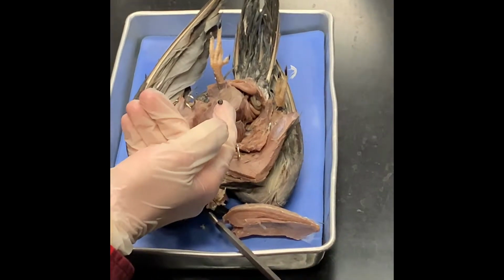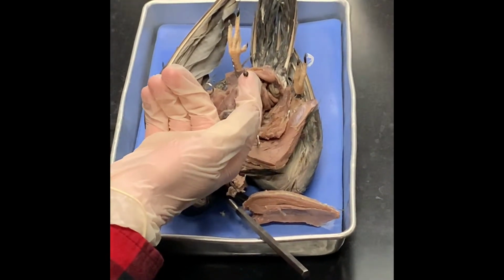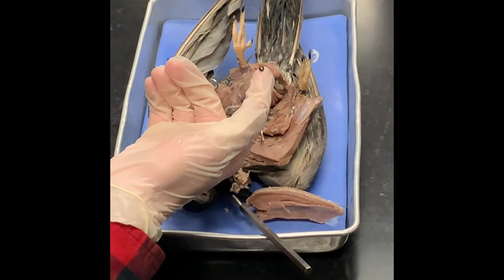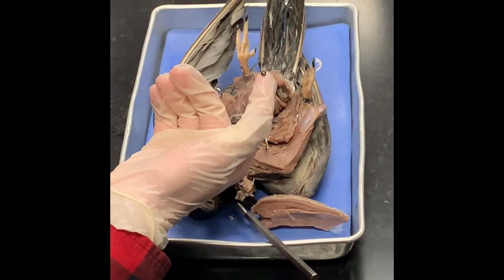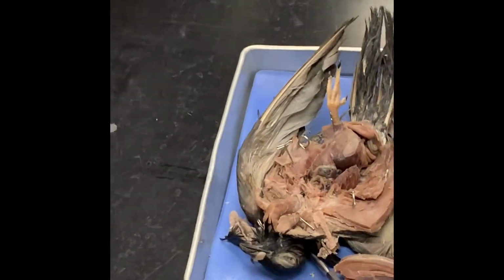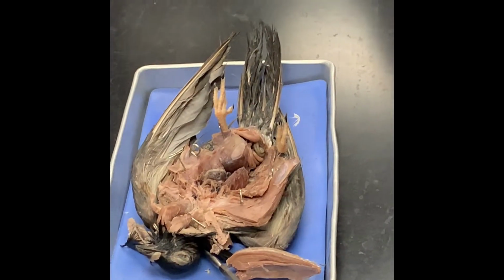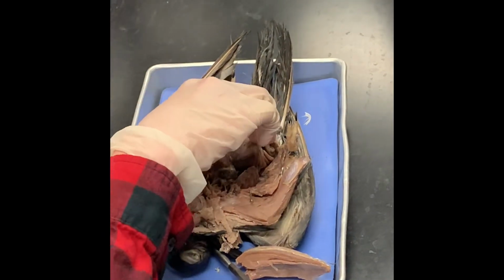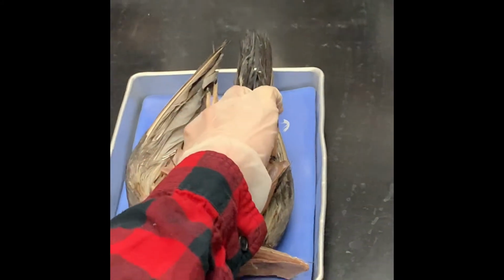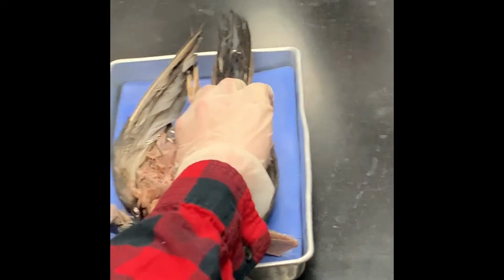Do birds experience positive breathing? No, they don't. They're negative pressure. We found one of the pebbles. It's a closed circulatory system, and then it's circular respiratory. Because it's pumping air in and out, filling the lungs with oxygen, it inhales and exhales.